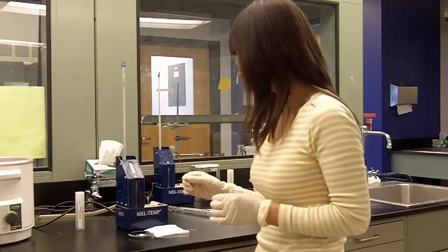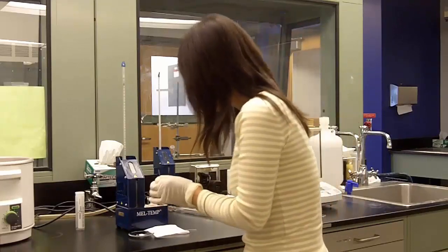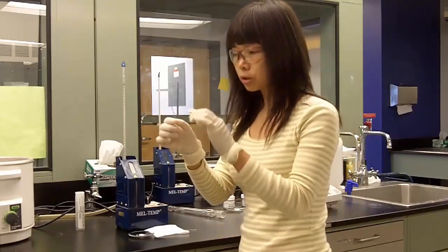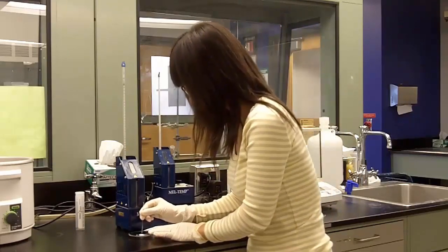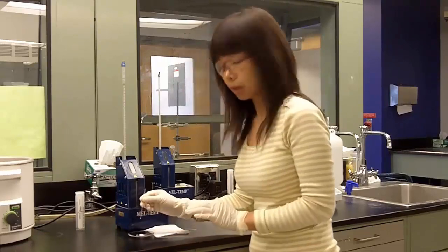Now let's start with packing the sample. You take a capillary tube, make sure the open end is pointing at your sample, and you tap very gently on your sample. Use the minimum possible amount of sample.